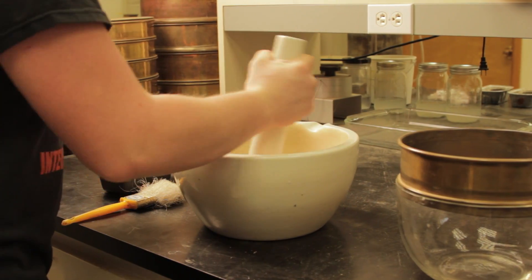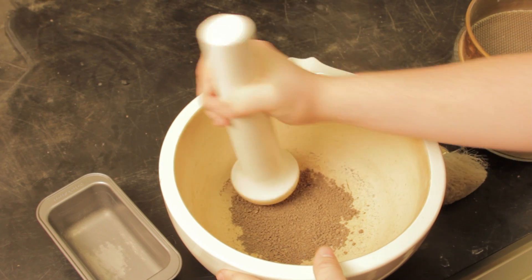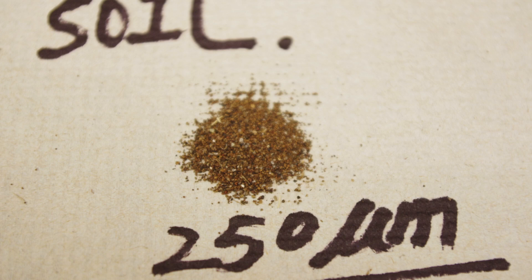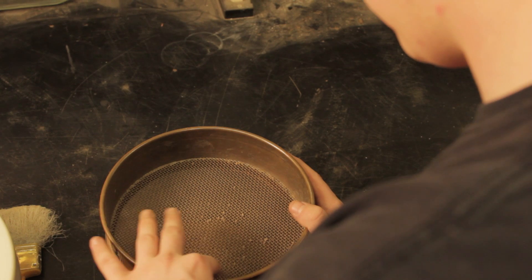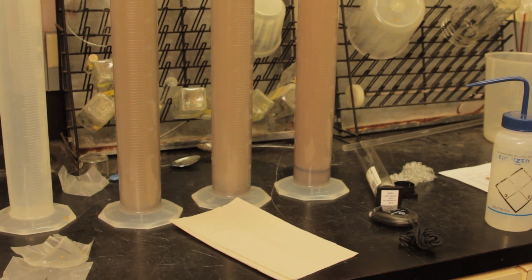We're also looking at the particle size distribution of these soils — the percentages of sand, silt, and clay, and what size the particles are within a sample. We break them up into individual particles, mix them up, and then measure the density of the solution through time. The heavy stuff like the sands fall out quickly, and the silts and clays remain in suspension for a long time.